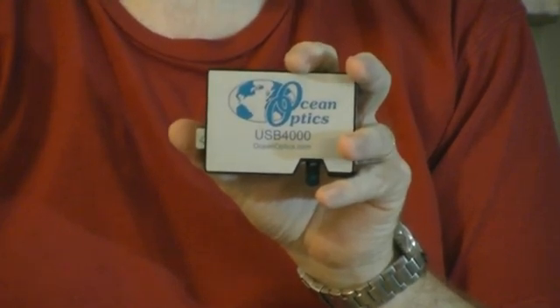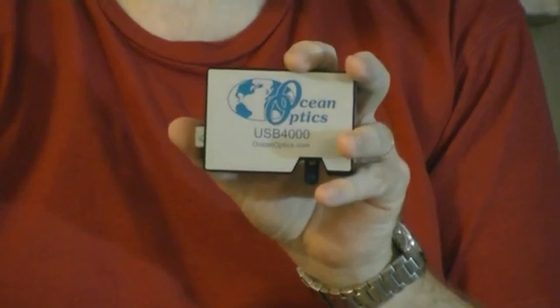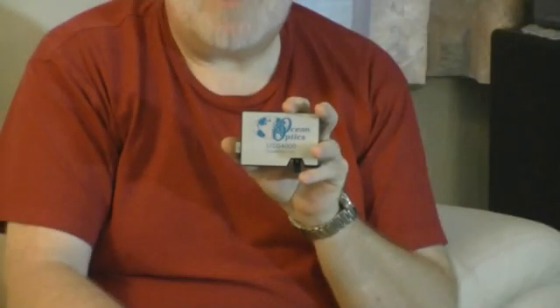This is the Ocean Optics USB 4000. The complete device fits snugly in my hand — it's no bigger than this. We had it custom fitted with a 50 micrometer entrance slit and a cylindrical lens to enhance the capture of ultraviolet on the sensor.